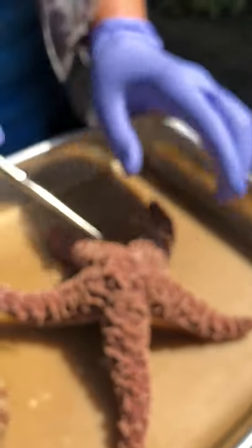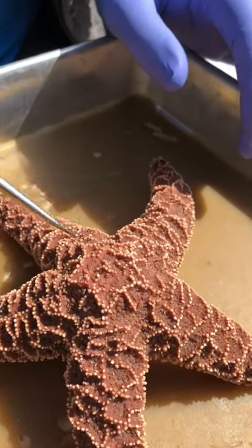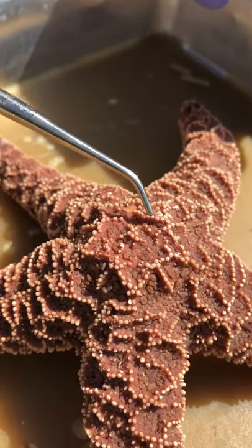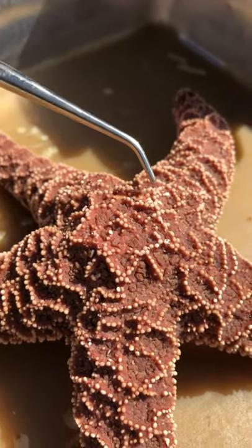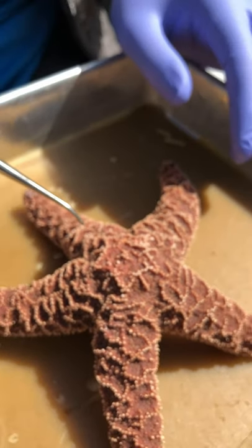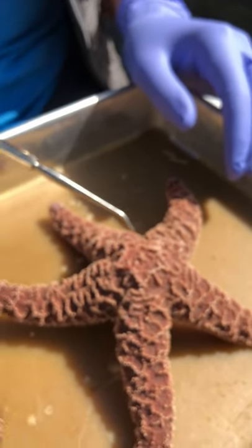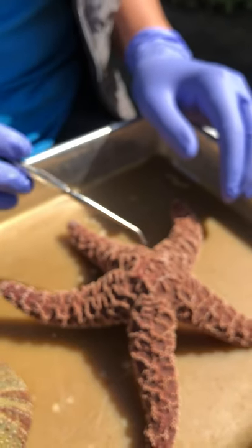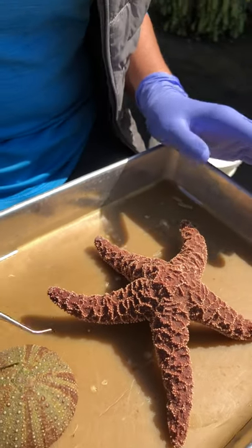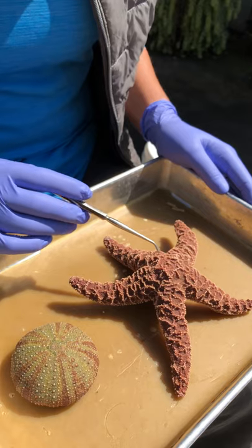On the aboral side, that's where the anus is going to be — it's going to be right about in here. It's hard to see the anus on actually both of these, but especially on the star. So let's go ahead and do some external anatomy on the star, and then we'll do the sea urchin in another video.